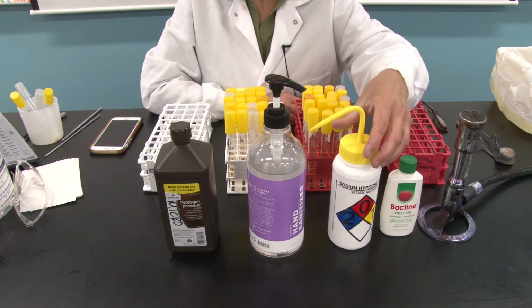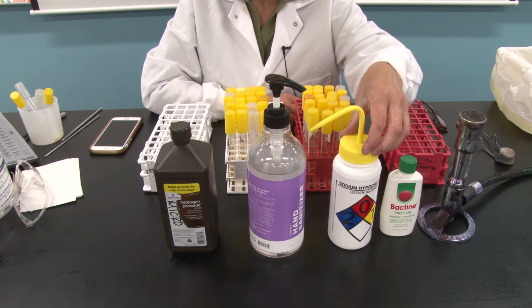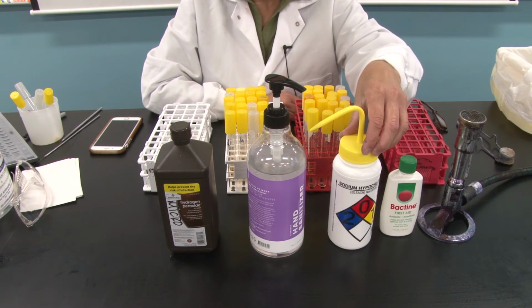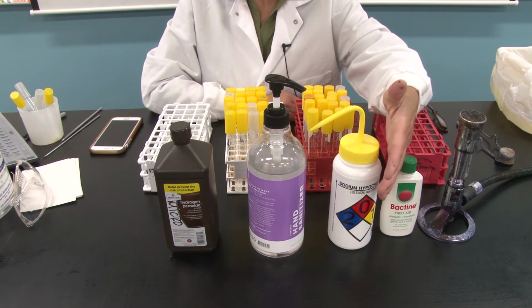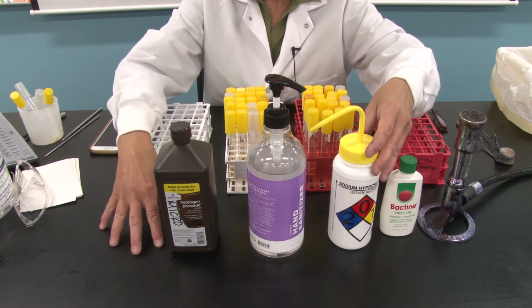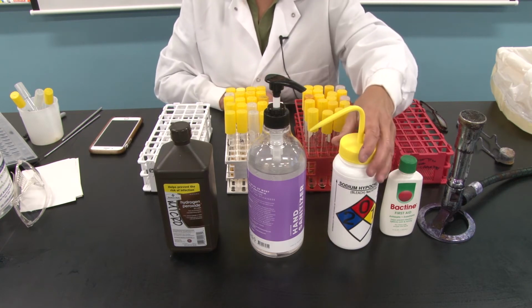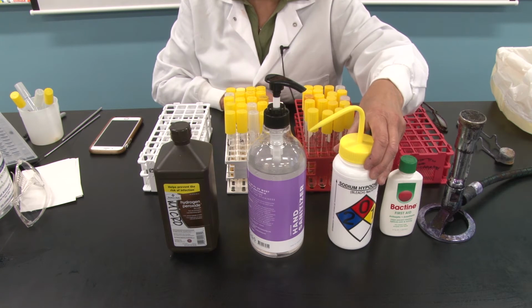10% bleach. 10% bleach is solely a disinfectant. This is something you should not put on your skin. Why? Sodium hypochlorite is corrosive. It'll take off the top layers of your skin. We use it to disinfect laundry. We use it on inanimate objects. You and I use it in this class on the surfaces of our lab stations. So this is what I told you on the very first day, a very effective disinfectant.